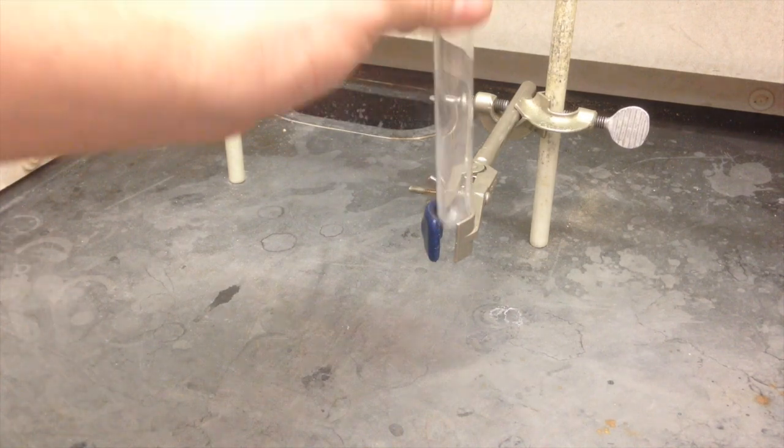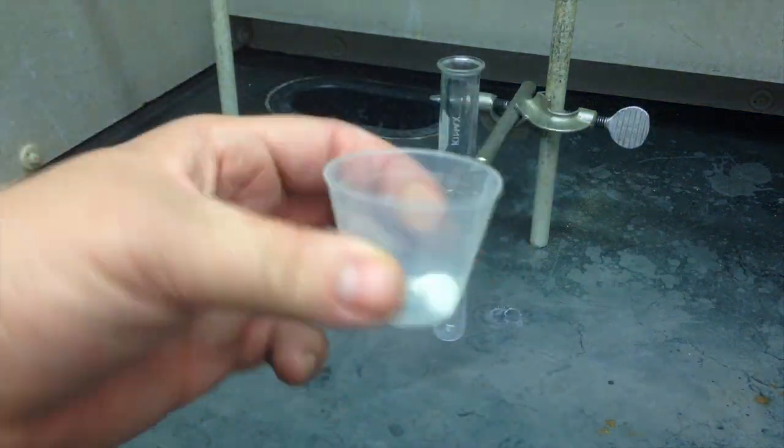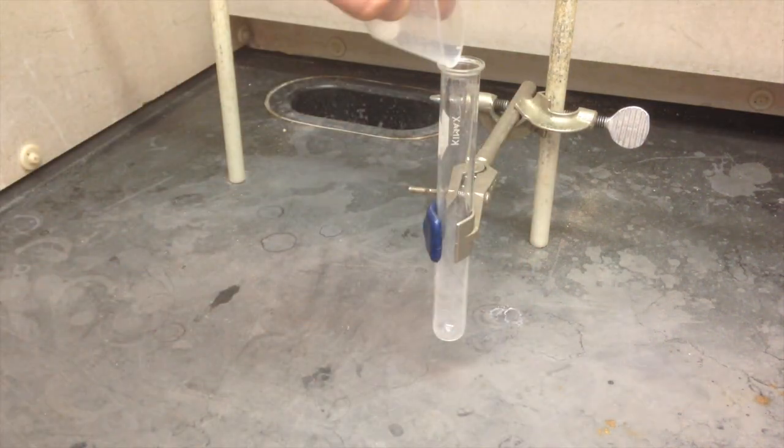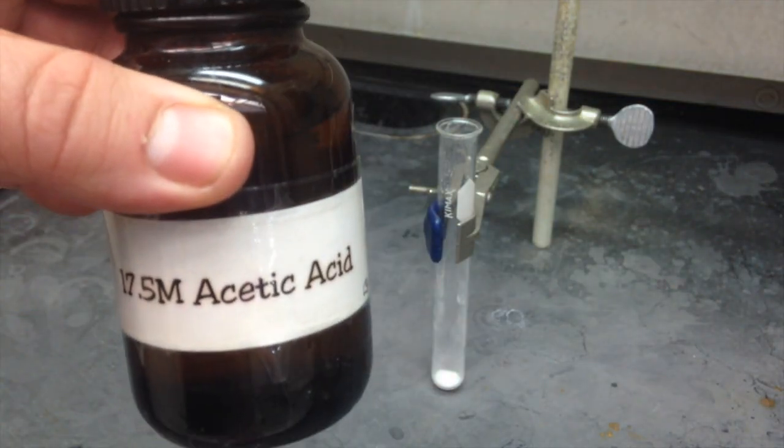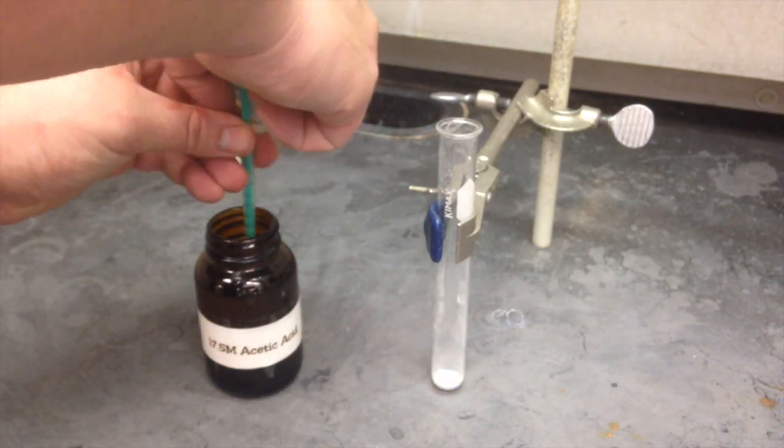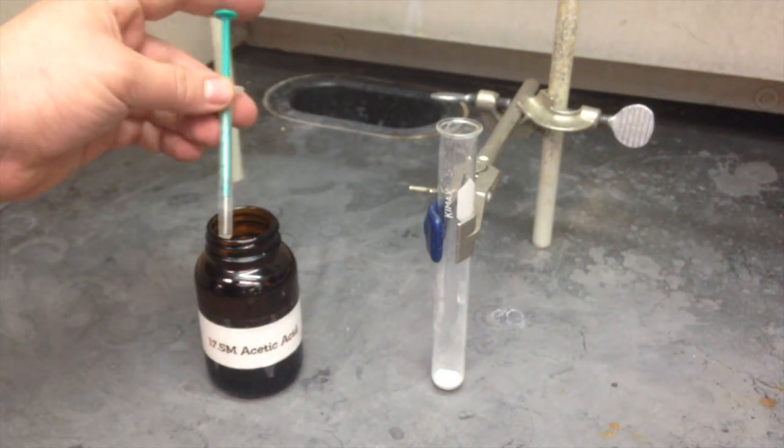Most of the setup for the rest of this lab is pretty straightforward. If you squeeze your weighing cup, it makes it easier to pour it in. If there's a hard part, it's definitely using these syringes. You don't measure the tip of the plunger, you measure a little bit down from that, where the green part of the plunger meets the clear part of the syringe.